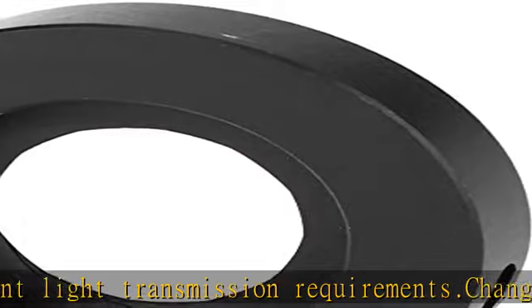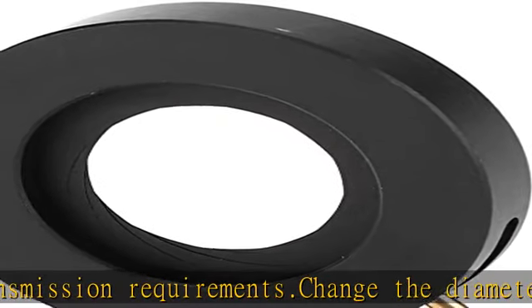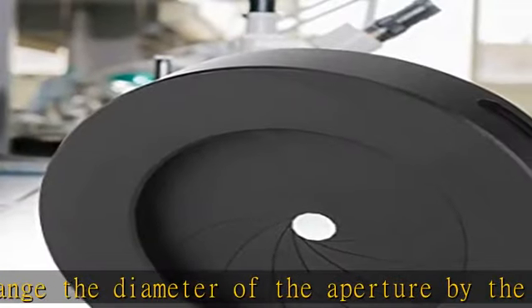Compact and practical design makes the diaphragm work more stable. Check the description to get this product today at the best price.